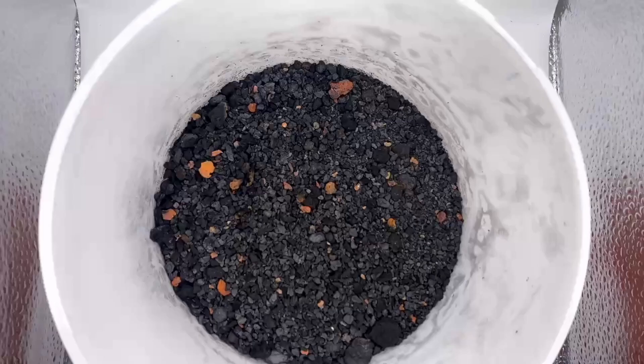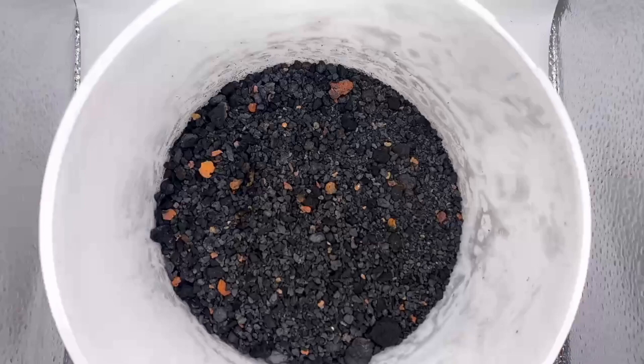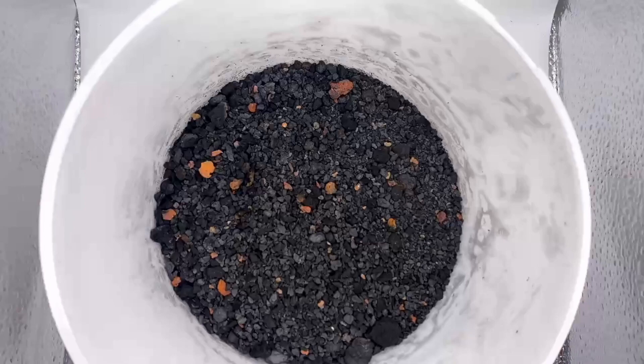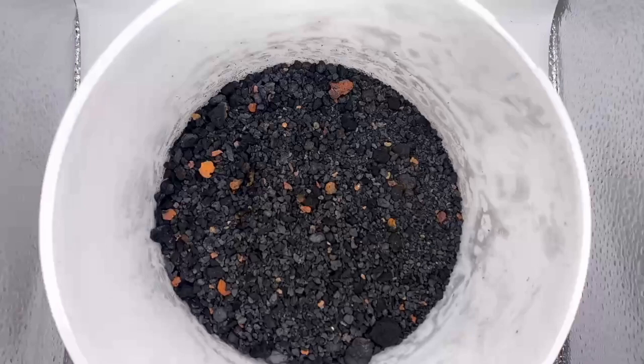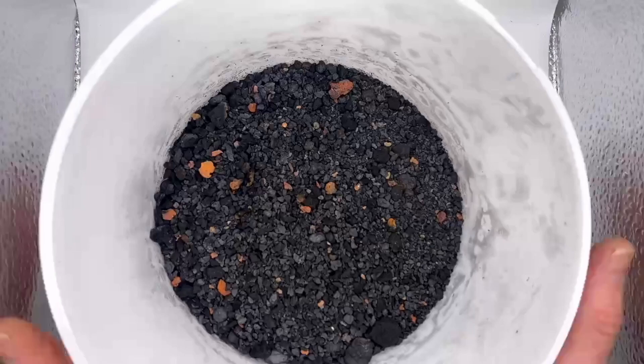Here we're visually inspecting a biochar sample that has been collected and cooled. We set up the trial schedule to allow us to test a number of parameters. This means we collect numerous samples of biochar during the trial runs. This way we're able to compare the effects of changing process variables like temperature, residence time, bed depth, etc.